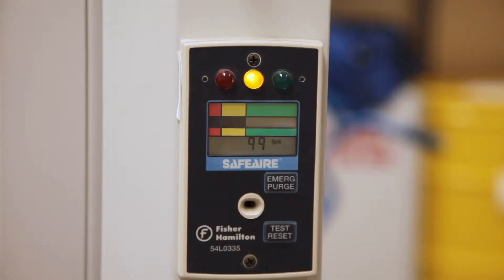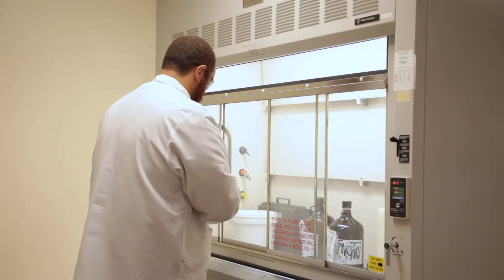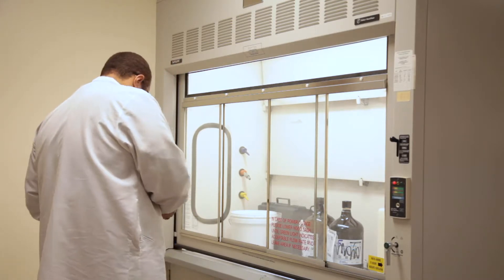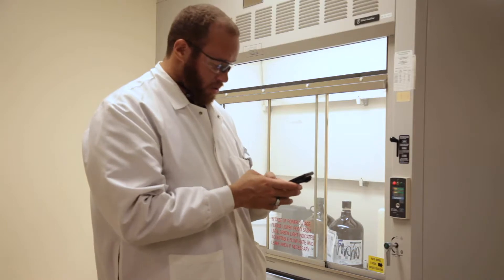By regulation, alarms are required to activate once the fume hood falls below 80 fpm. Manually deactivating an alarm is prohibited. If your monitor indicates the fume hood is not functioning at 100 fpm when the sash is placed in the correct position, or if the alarm goes off, stop all operations in the hood and contact EH&S to have your hood inspected.